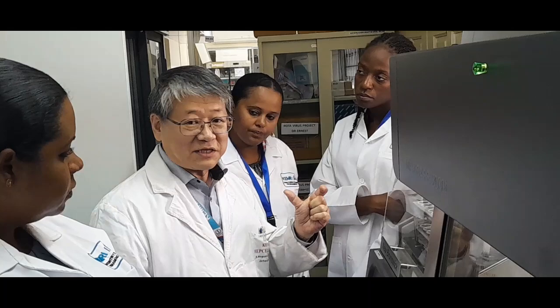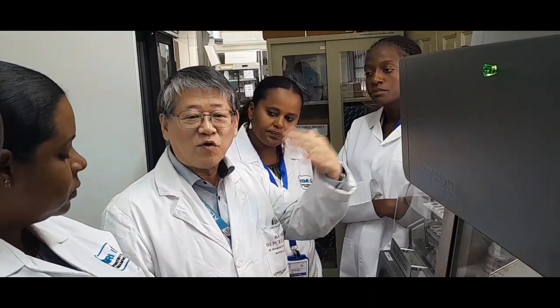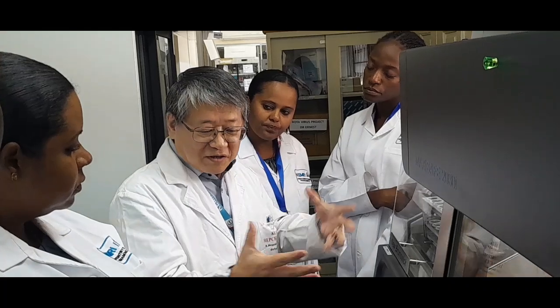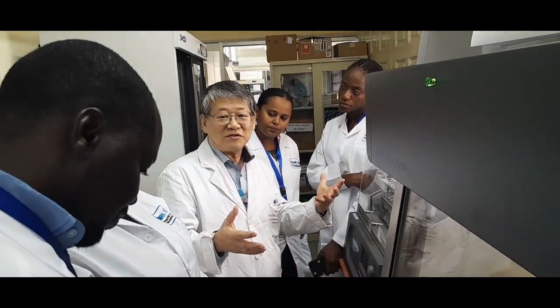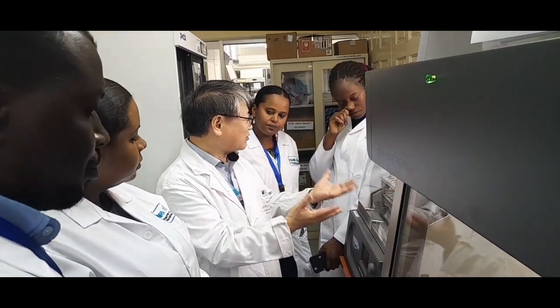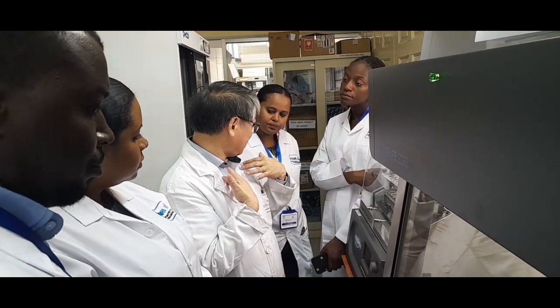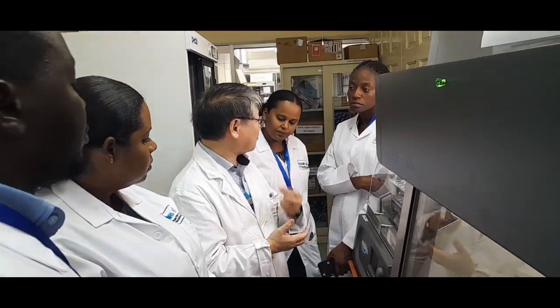It's much safer, isn't it? For example, for a BSL-3 or BSL-4 pathogen, if you culture 1 liter or 2 liters, it's very dangerous, isn't it? But with the E. coli expression system, it has no infection ability, so we can safely produce enough.